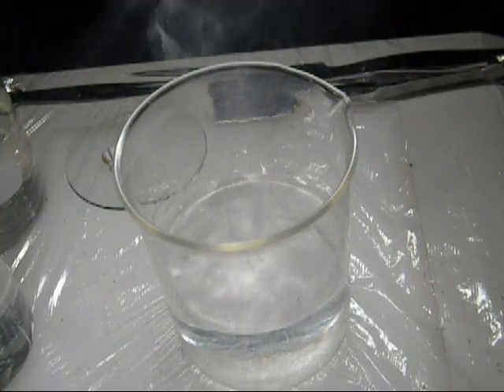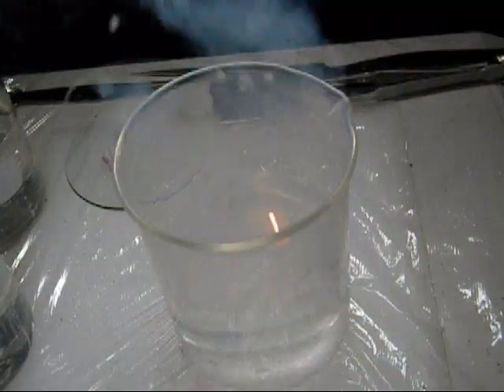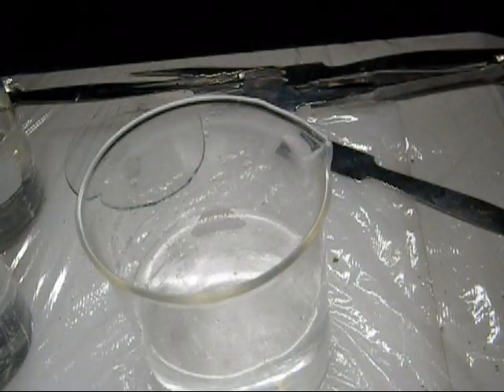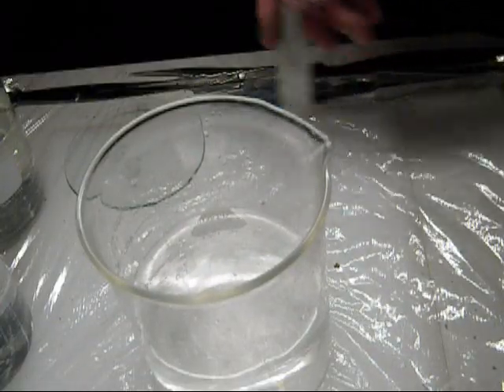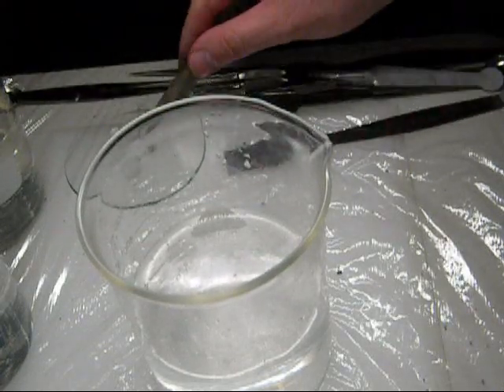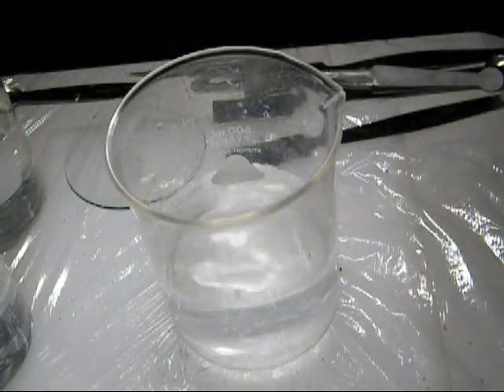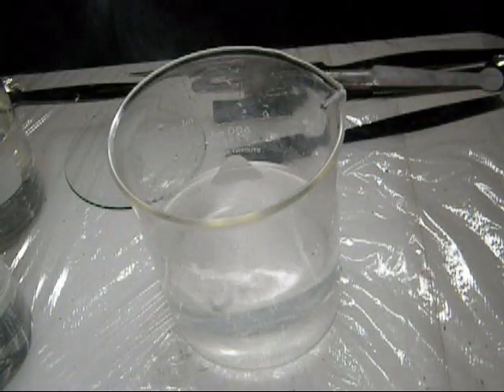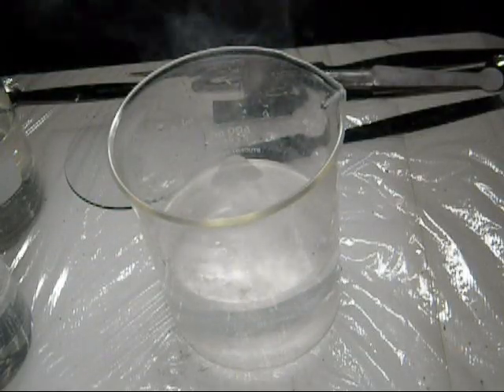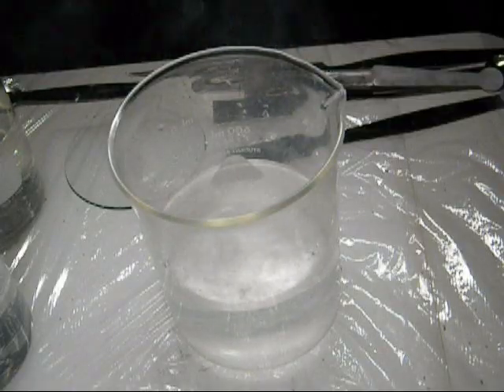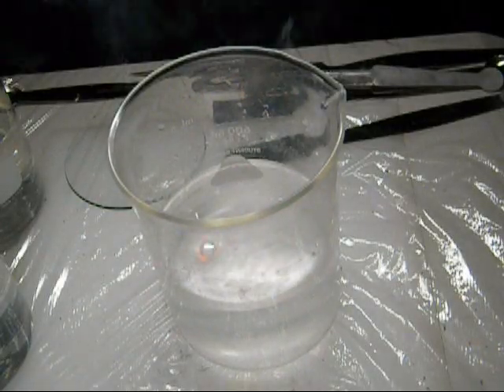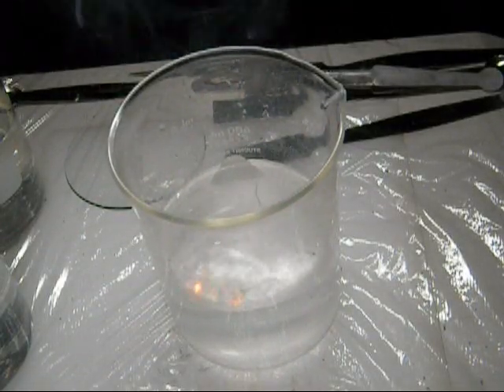You'll notice immediately that it turned into a spherical shape. It's actually molten. Oh, yeah. And you can see why I stepped away. We'll try again here with the sodium metal. Now, it doesn't always catch on fire like it did there. Like you can see, it's got a, it's turned molten, and because it's molten, it forms that ball shape. It's actually a molten metal there on the surface. There we have the fire. The fire is what color, by the way? Orange. Orange. It's an orange flame.